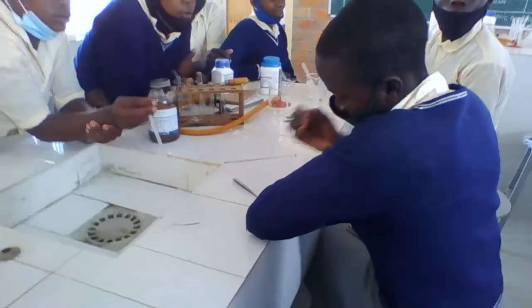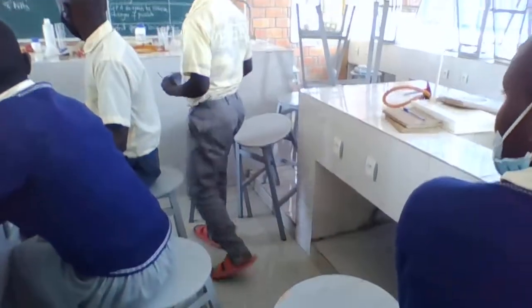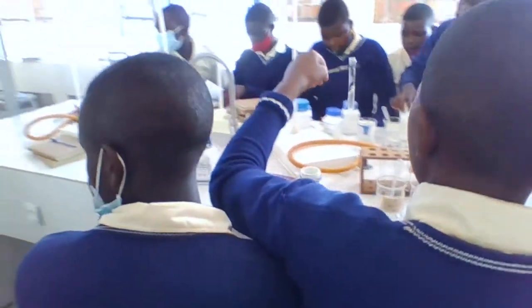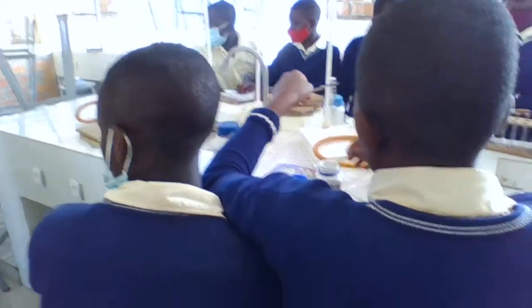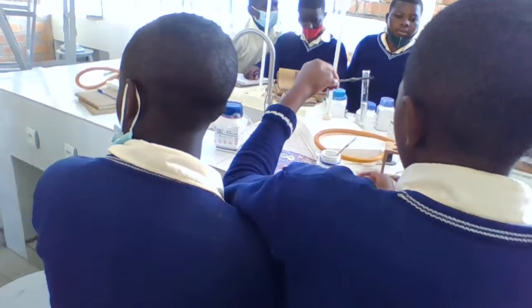Go and bring the test tube holder. Go and check it. It is there, I know. Test tube holder. You don't know it.